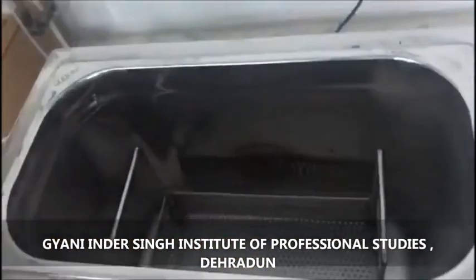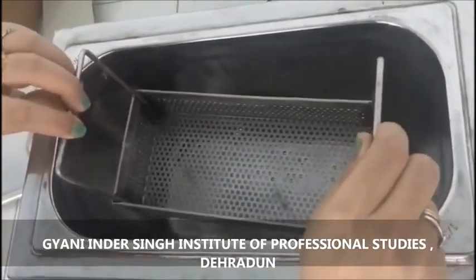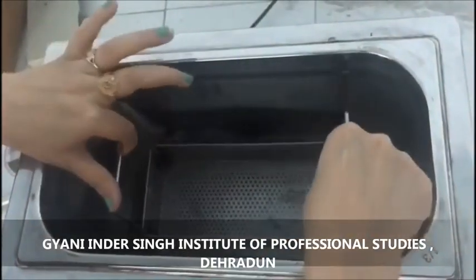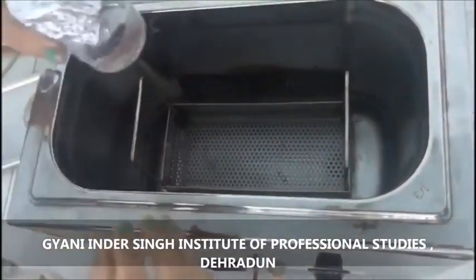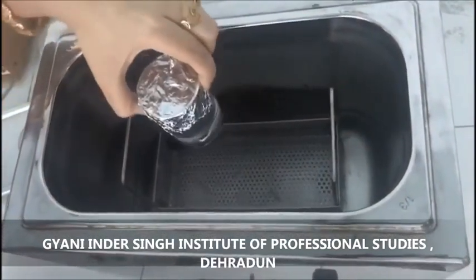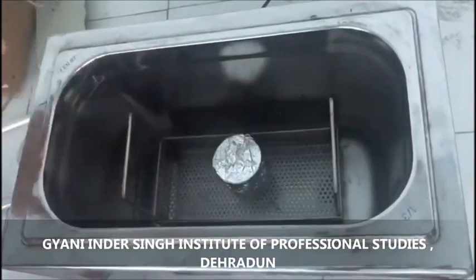The whole body is made up of stainless steel. This apparatus contains a mesh for installation of the sample and a water bath to avoid extreme heating, which occurs at the bubble interface. I have put the sample in here, and it is covered with aluminum foil to avoid evaporation of the solvent used for preparation of the sample.